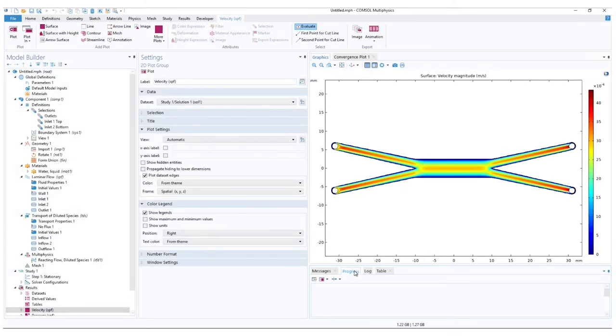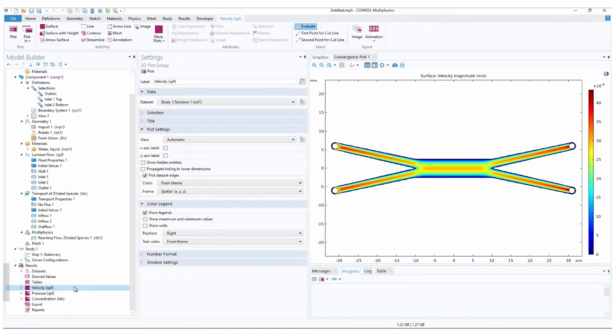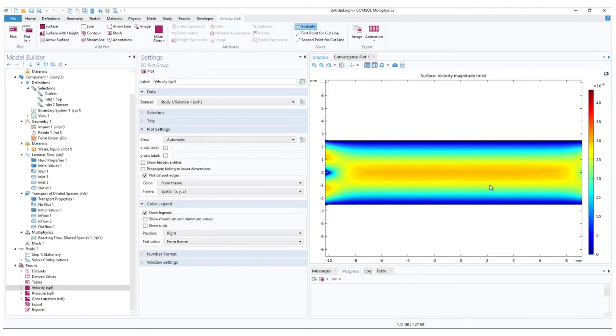Once the simulation is done, COMSOL generates different graphs of relevant parameters. Here we have the velocity graph. We can see how with our symmetric design the flow rates are also both symmetric at the inlets and outlets. Here we can notice how faster flow rates concentrate in the middle of this design.